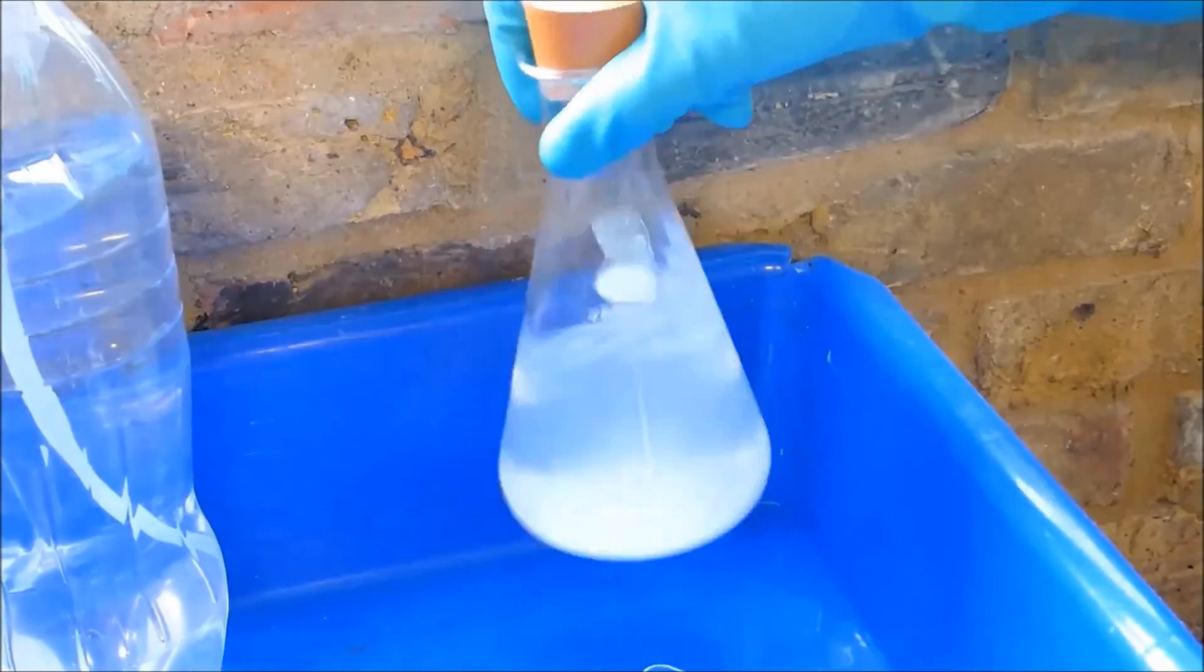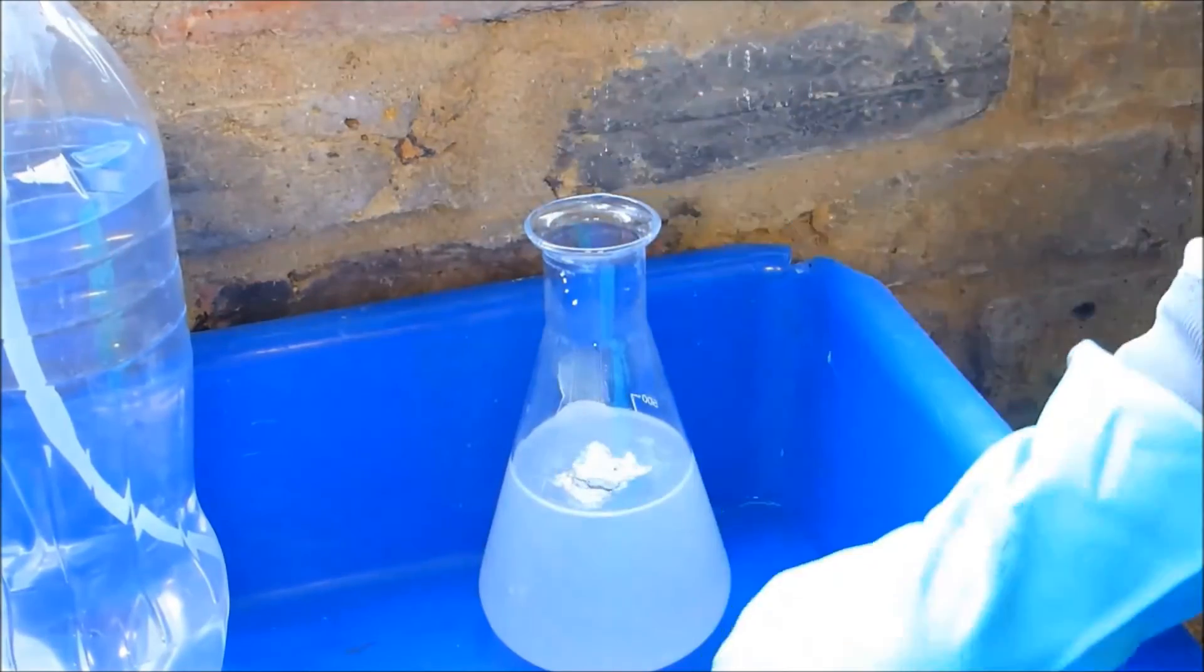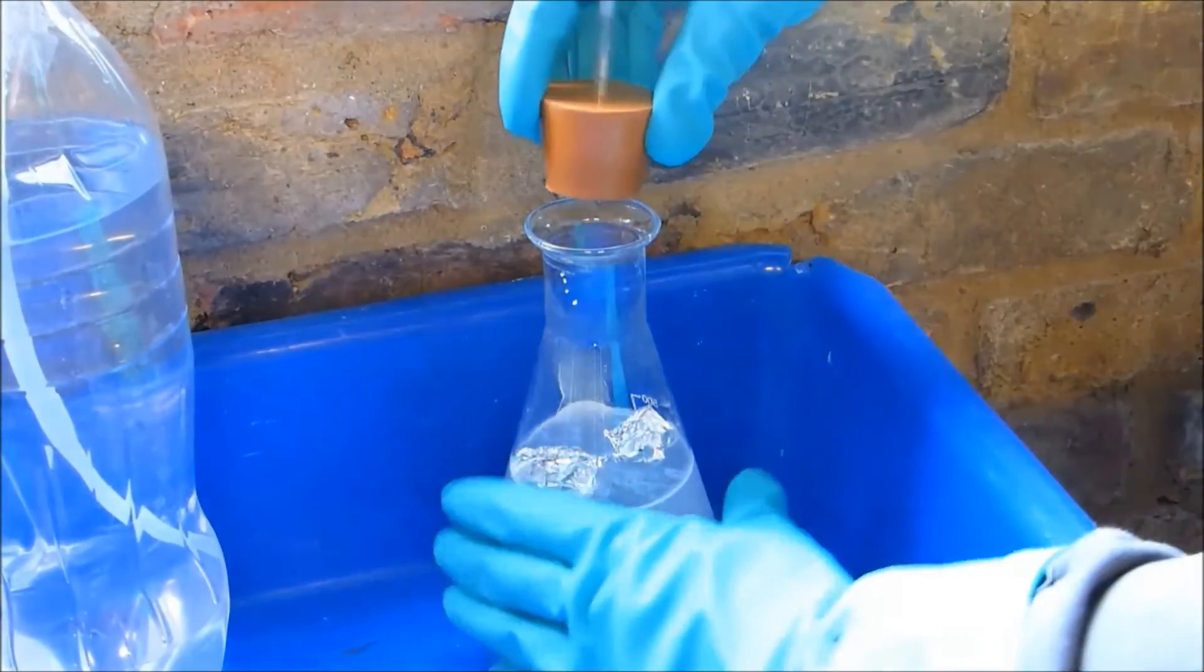Once that was dissolved, I added the balls of aluminium foil and replaced the rubber stopper.